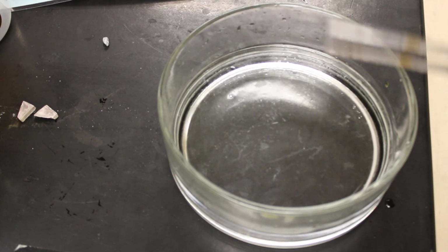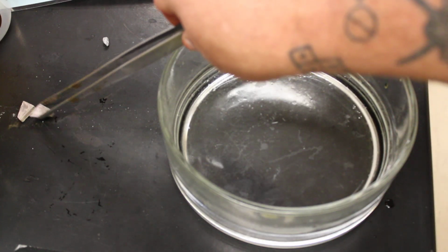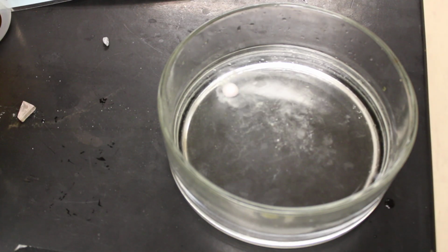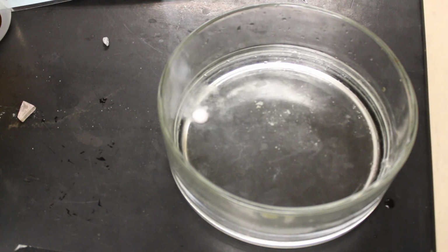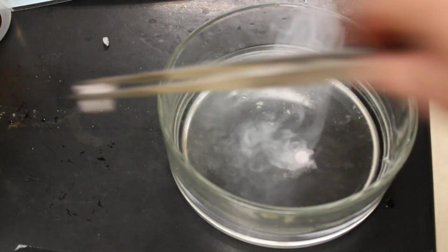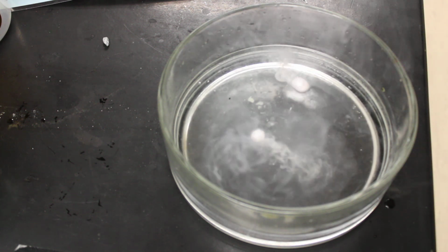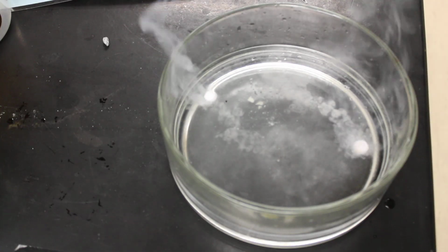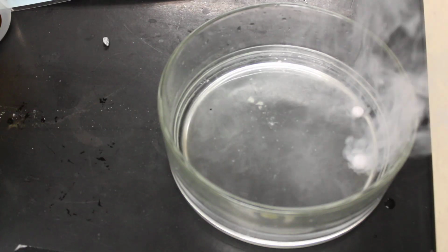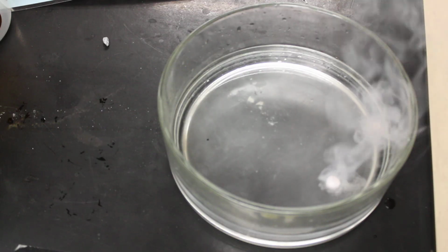Okay, now we're going to move down one period and we're going to go to sodium. This is sodium metal. All right, and we're going to see how it reacts with water. And you can see that that is a little bit more aggressive, shall we say. I'm gonna put this other piece in there too, just so we can see two of those guys humming around there. Same thing's happening in the water, it's just now we're a little bit more aggressive in the reaction. You can see all the hydrogen gas that we're making there.